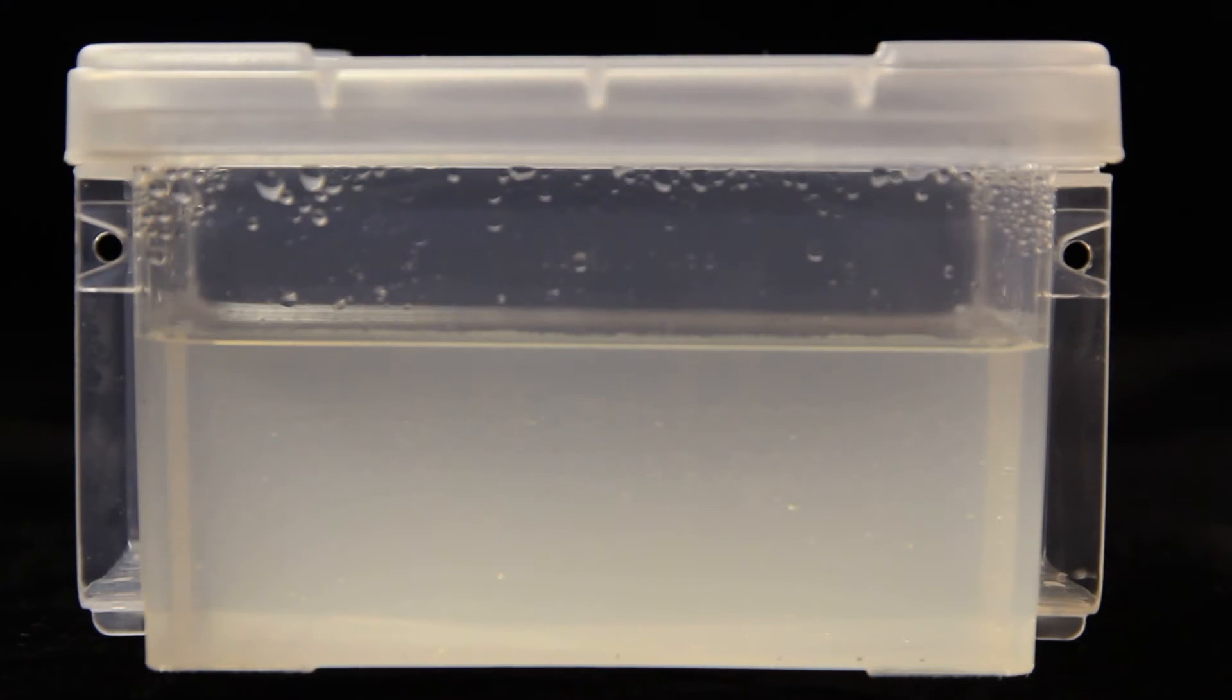In this demonstration, instead of taping the seed crystal to the wire, I wrap the wire around it. Here's how it grows.